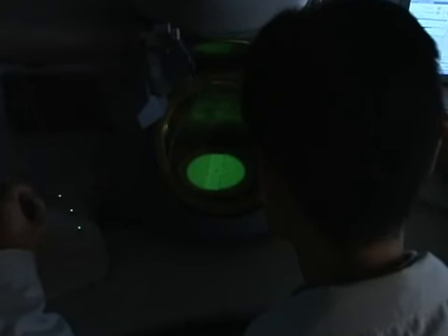Another important feature of this microscope is its ability to observe and analyze at very low temperatures, such as those of liquid nitrogen or liquid helium. Unfortunately, some samples fade during observation due to electron bombardment. Polymer material is a typical example of this.